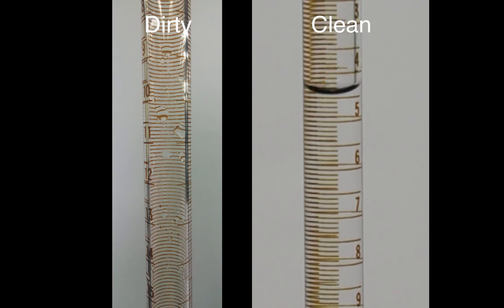Cleanliness is indicated by the presence of an unbroken film coating the inside surface of the burette when deionized water is drained. Note that this test only works for distilled or deionized water.